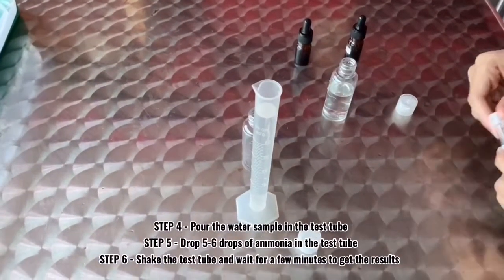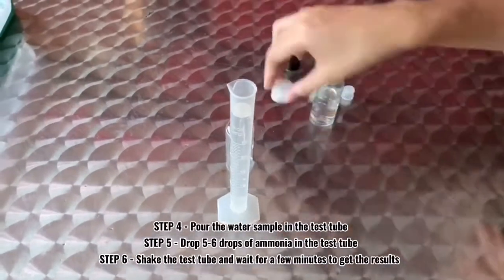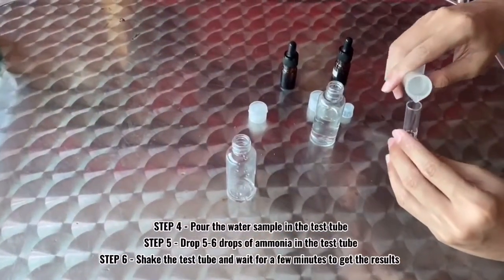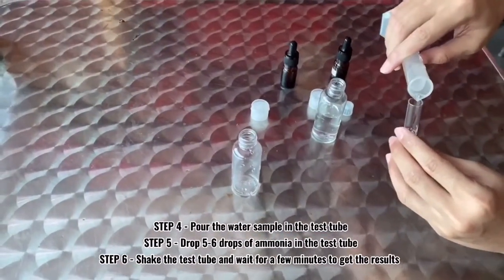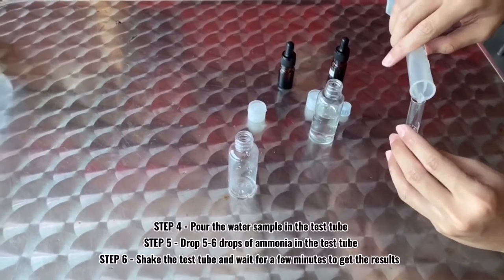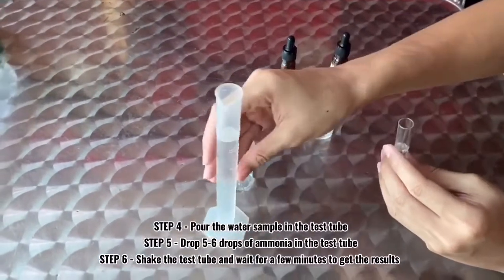Step 4: pour the water sample into a test tube. Step 5: drop 5 to 6 drops of ammonia into the test tube.